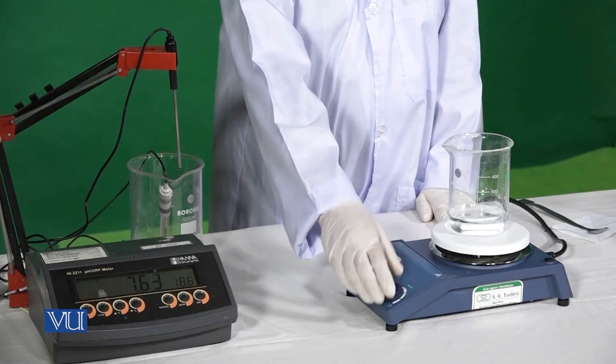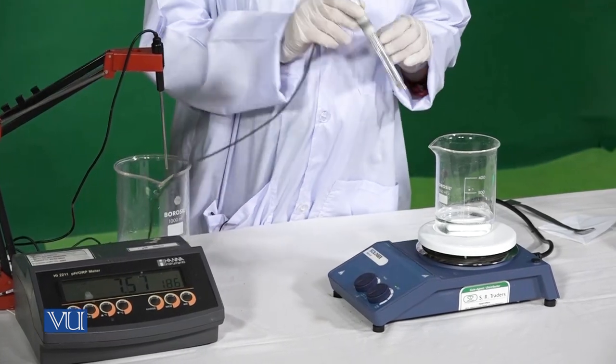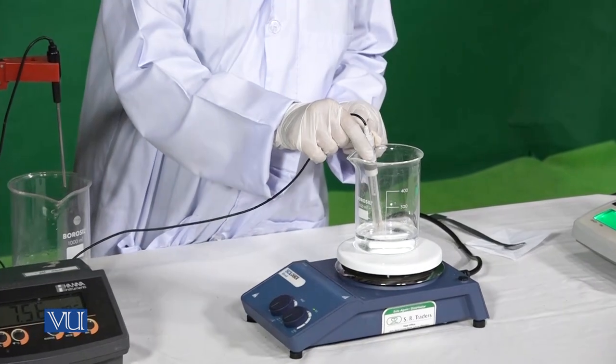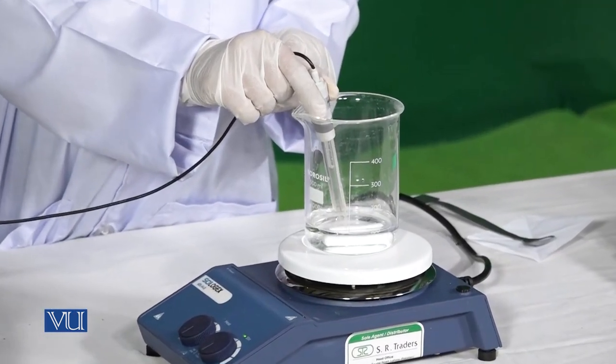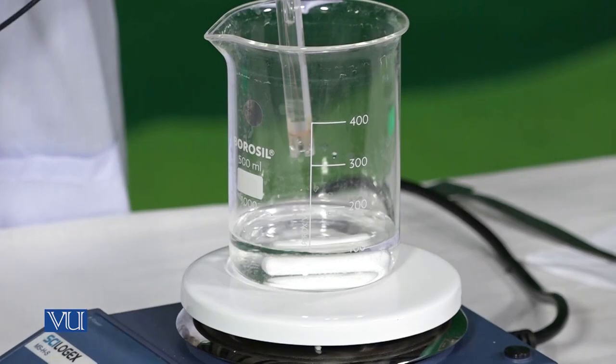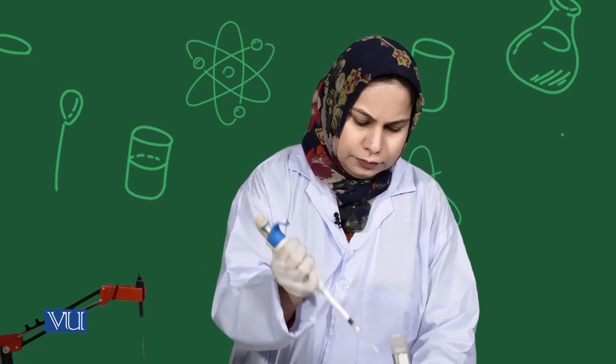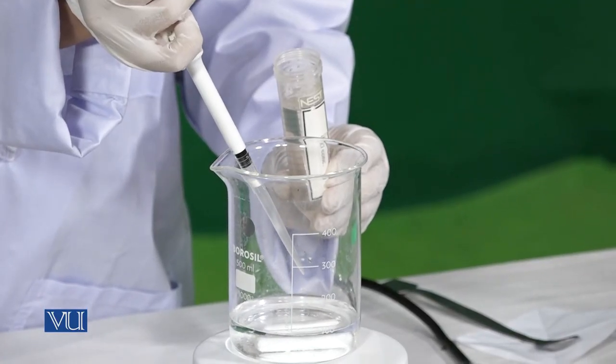After dissolution of the complete powder, we will check the pH of this solution using the pH meter. Before adding the probe into the solution, we need to wash the probe. The pH of this solution should be 8. For adjusting the pH, we will need to add acid. We are going to add acid drop by drop until its pH becomes 8.